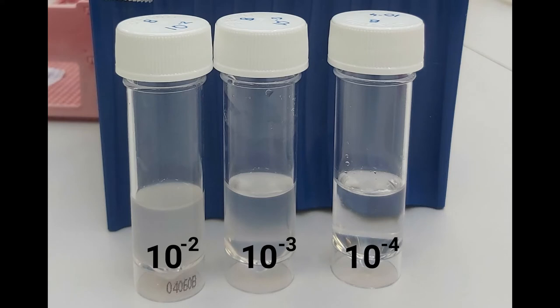By the end of this, you should have three universals for Sample A and Sample B. You should be able to see the visual differences between each of the dilutions.